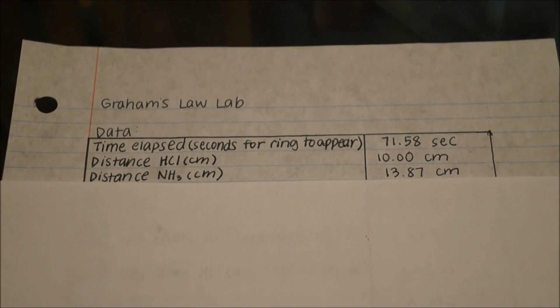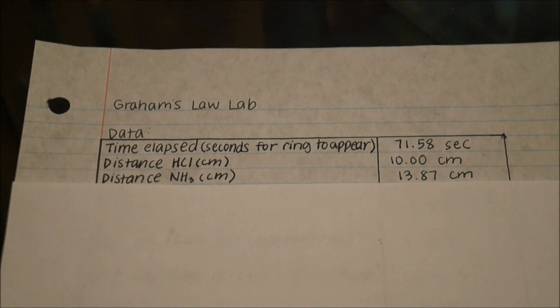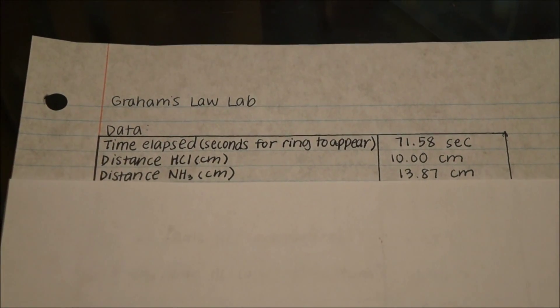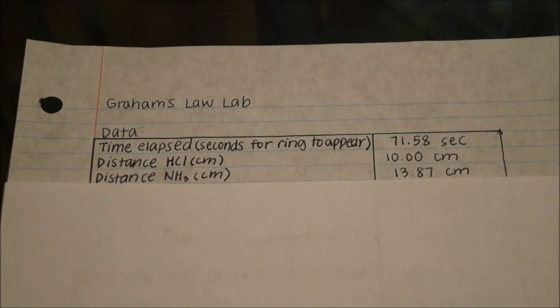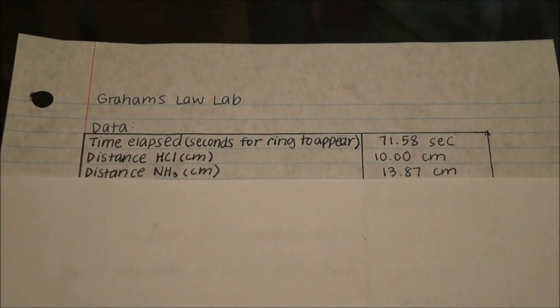The distance from the hydrochloric acid q-tip to the ring was 10.00 centimeters, and the distance from the ammonia q-tip to the ring was 13.87 centimeters.